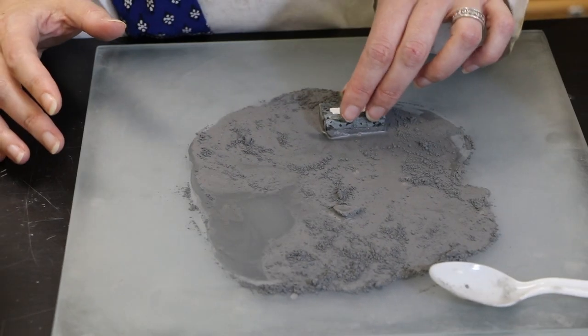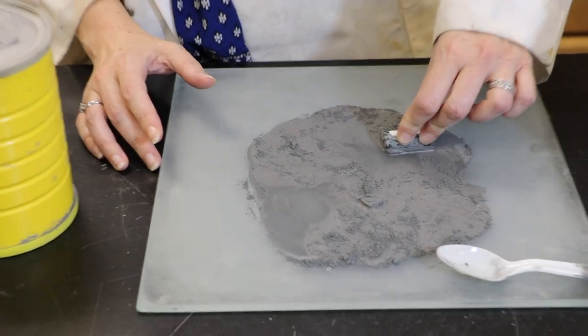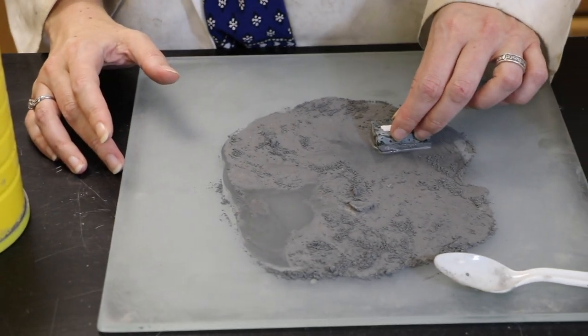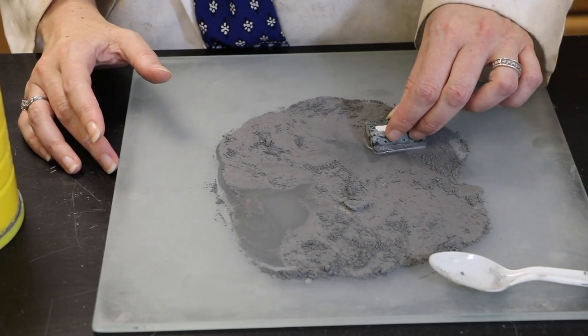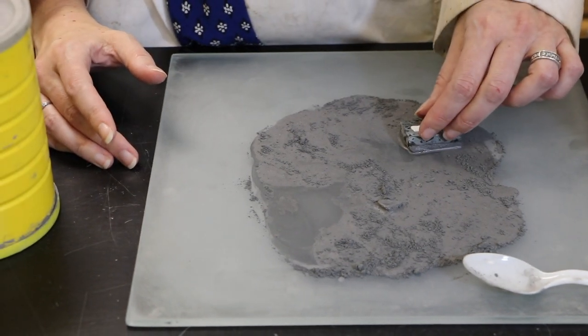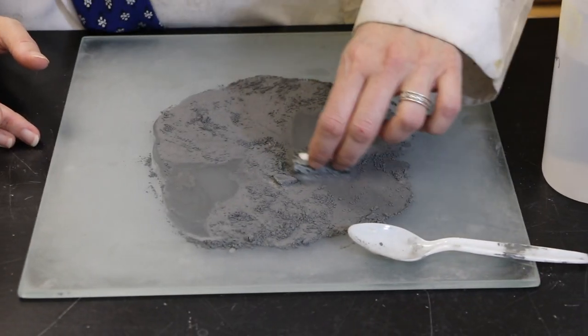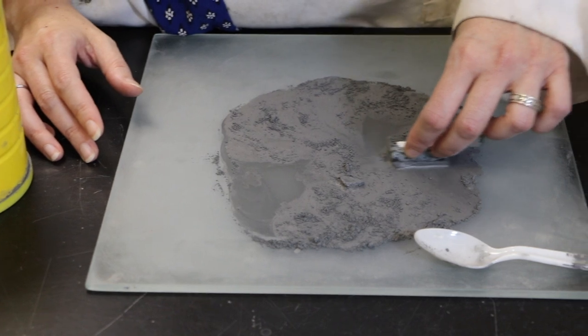The motion that actually causes the polishing is the side-to-side motion and not by pushing down really hard. This is important because you can actually injure your hand and wrist and give yourself carpal tunnel syndrome if you push down on these too hard for too long of a time period.